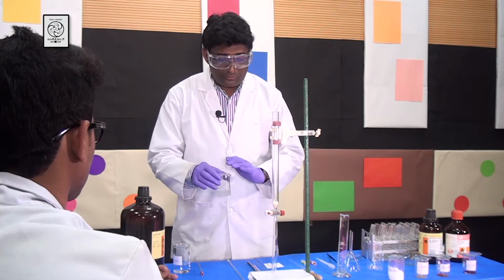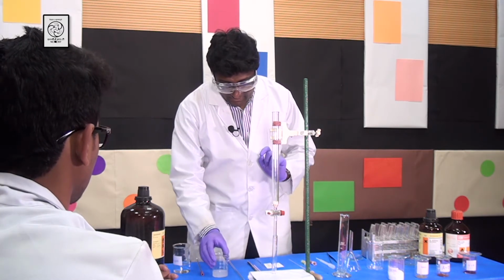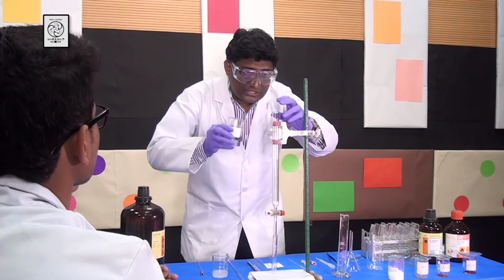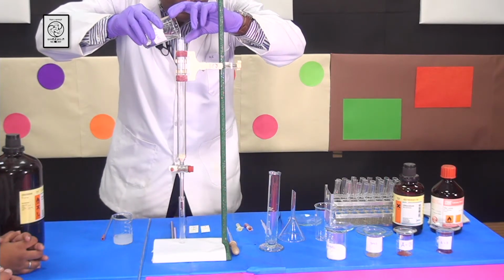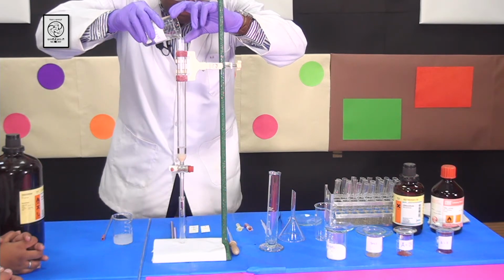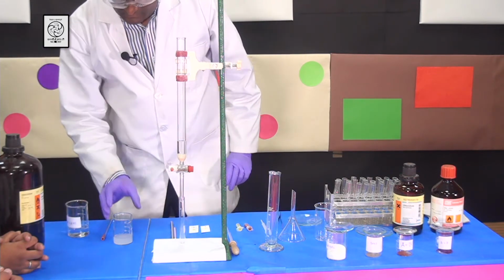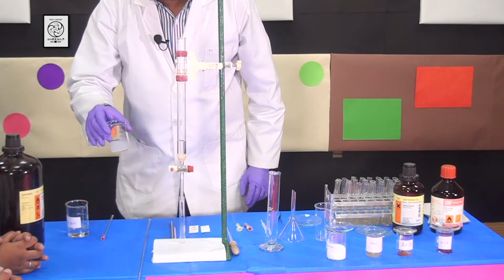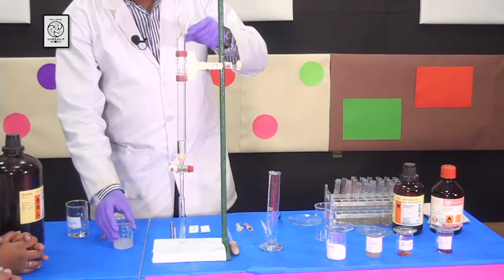Okay? So students, I have made the slurry of silica gel and I have to load this slurry of silica gel into the column. But before doing that, I need to put a little bit of solvent into the column. I have to put it very carefully so that some of the solvent is right above the cotton. Okay? Okay, sir. Yes. Now I am going to load this slurry of silica gel using a glass funnel.